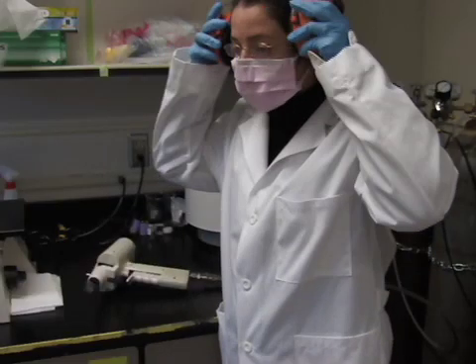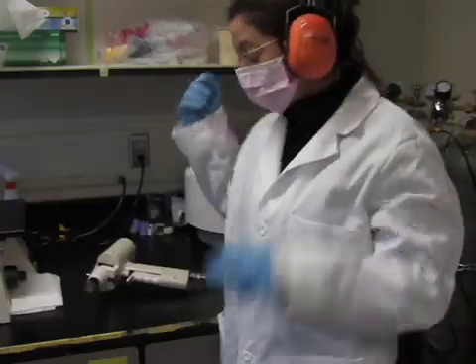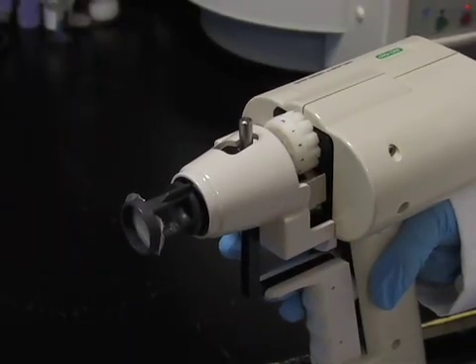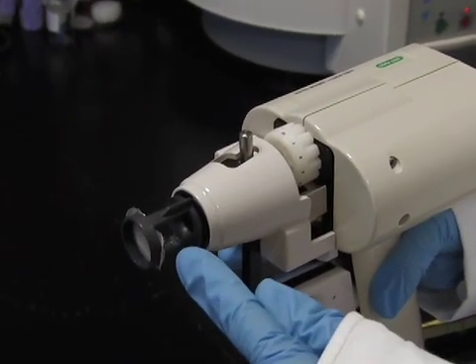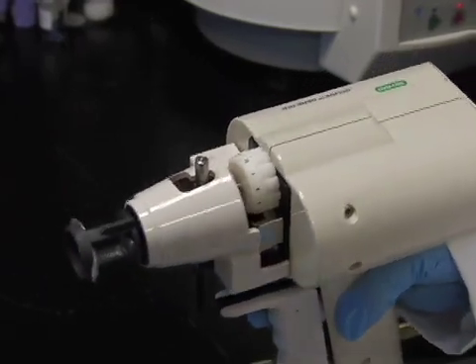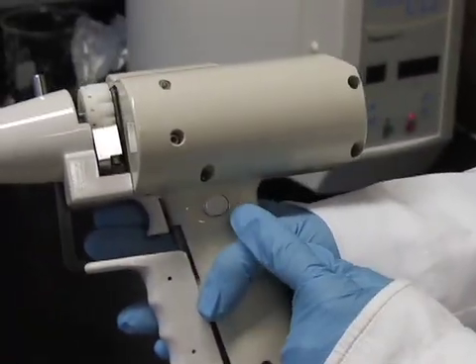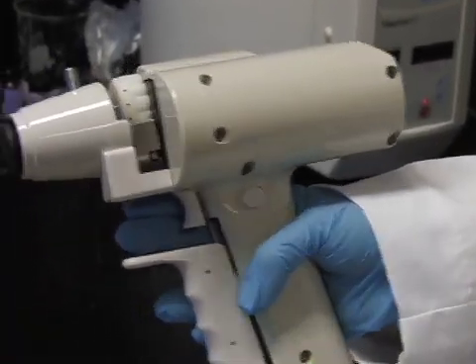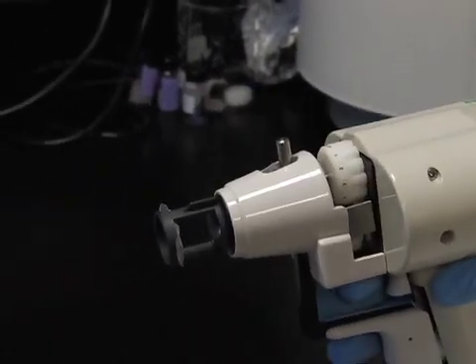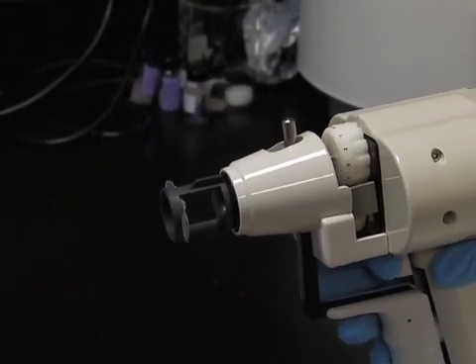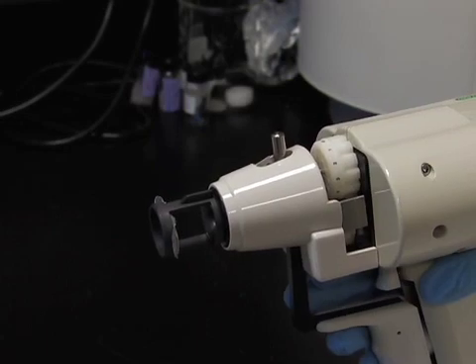But first remember to wear ear protection. And in order to remove any dust or debris from the diffuser screen, shoot a blank. To shoot the gun, first press the safety interlock button until the gun beeps and pull the trigger. Now we're ready to shoot the slice.